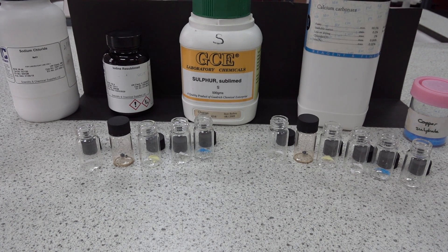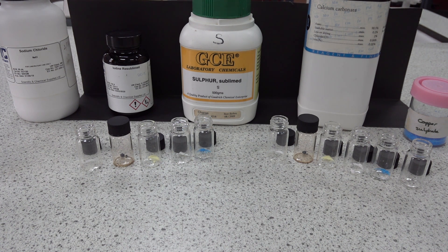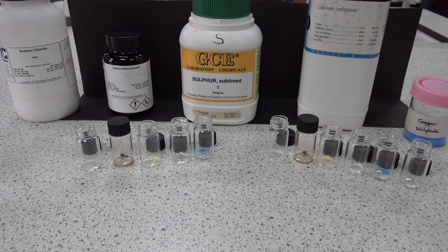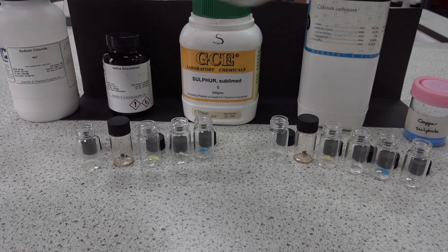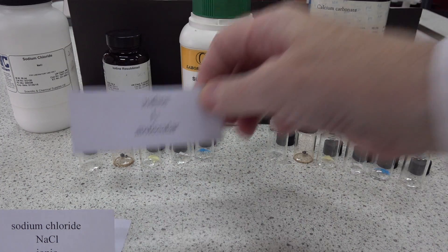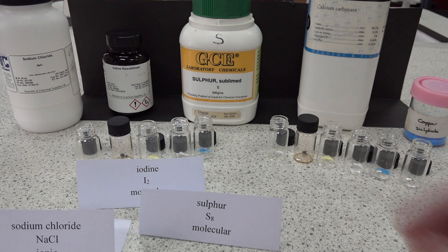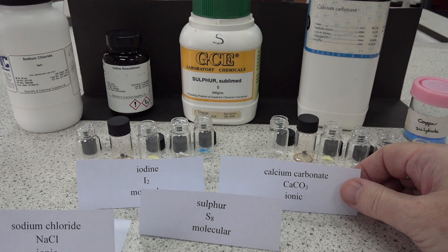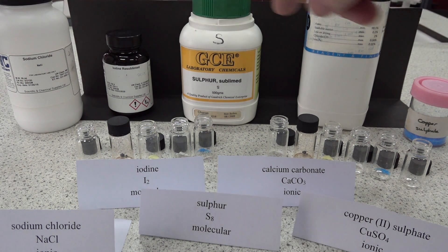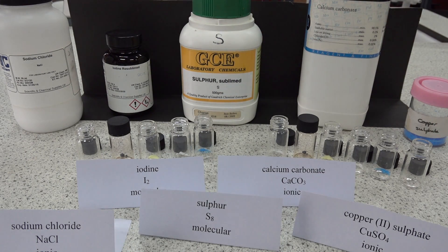This is an introductory chemistry experiment looking at the solubility of some solids in two solvents: water and cyclohexane. The solids, from left to right, are sodium chloride, iodine, sulfur, calcium carbonate, and copper sulfate. We'll be looking at the solubility of all five materials in water first, and then in cyclohexane.